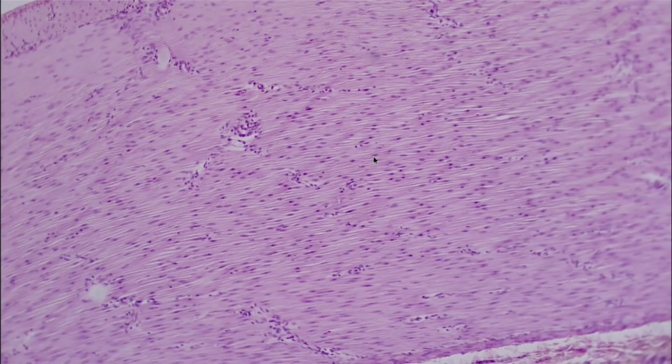Next, this is going to be our smooth muscle. Now, a lot of people mix up smooth muscle with dense regular, and so I really recommend looking at the two side by side, kind of like we've been comparing with some of our cartilages and reticular and blood. Take some time in the lab to compare and contrast the two so you can tell the difference on your exam.